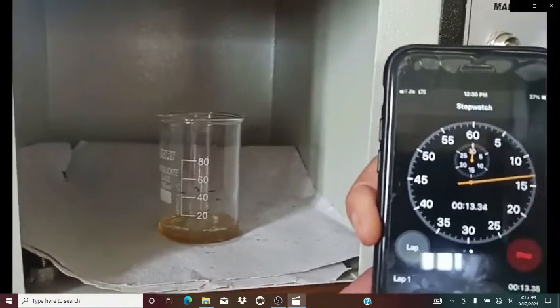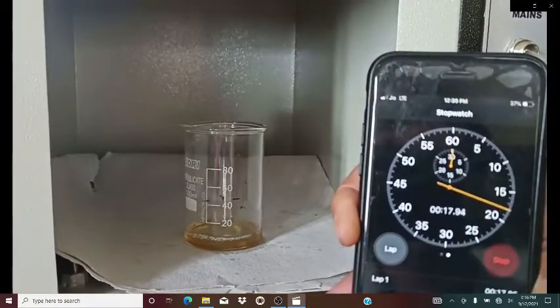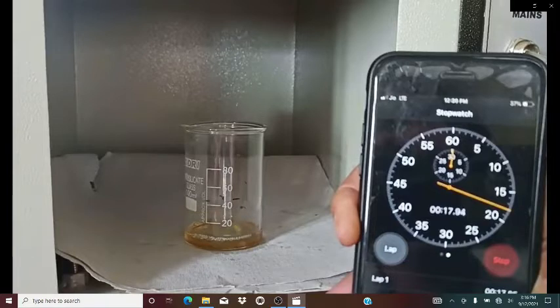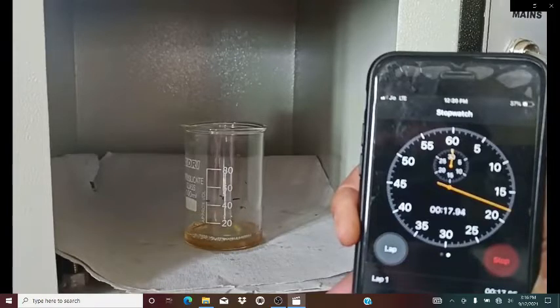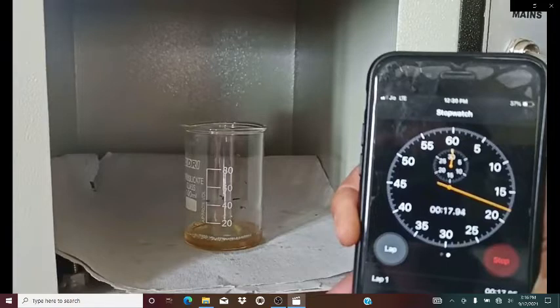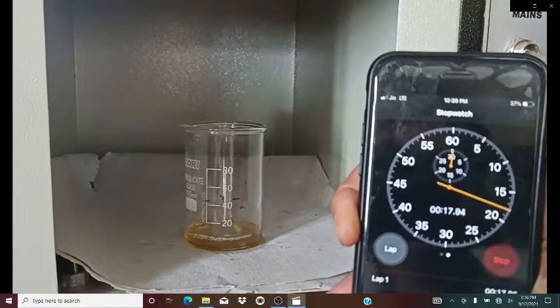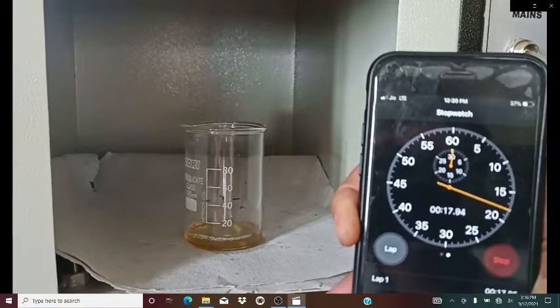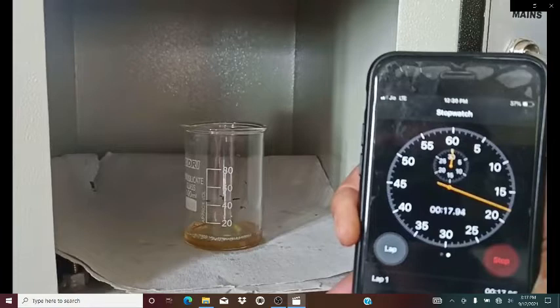The lubricating oil starts flowing. We let it flow and measure the time for the whole lubricating oil filled in the cylindrical vessel to drain out. That time will be the Redwood viscosity of the lubricating oil.